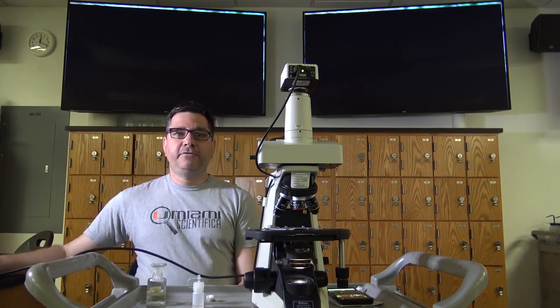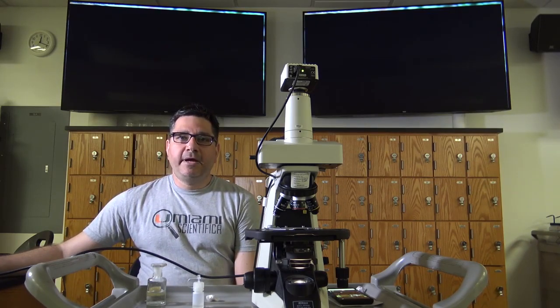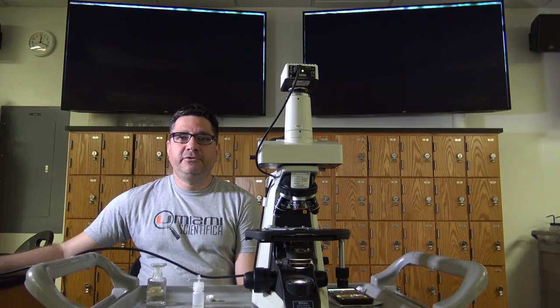To remove your microscope from the cabinet, please approach the cabinet and locate the number you are assigned. Next, each right-hand door can be opened simply by pulling on the handle. The left-handed door requires an additional step. Once you have opened the right-handed door, reach up on the inside of the left door and disengage the latch on the inside. Now simply pull the left door handle as you are disengaging the latch. Both sides of the door should now be open.